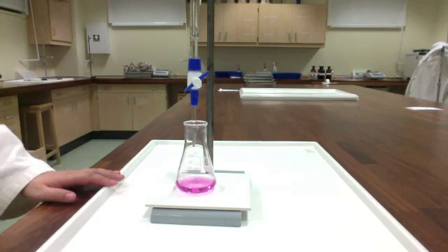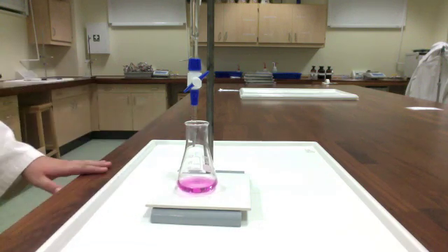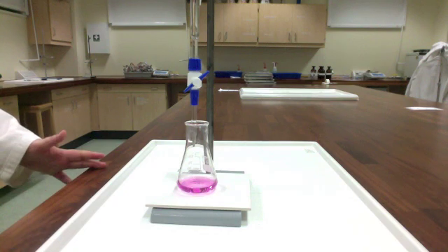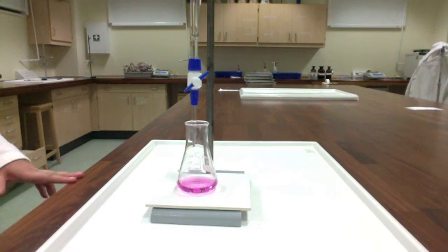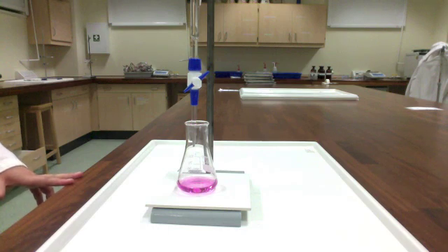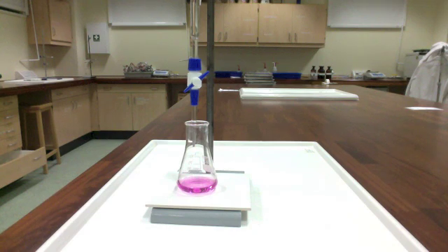So if I used, for example, these Erlenmeyers here, if I use them and they still were wet and still had distilled water left behind in them, I'm actually diluting the concentration of my sample. And so that's not going to help me out in this process. Really important, everything is both clean and dry.